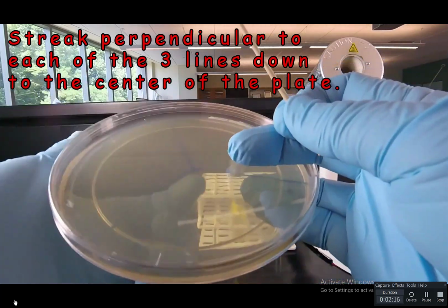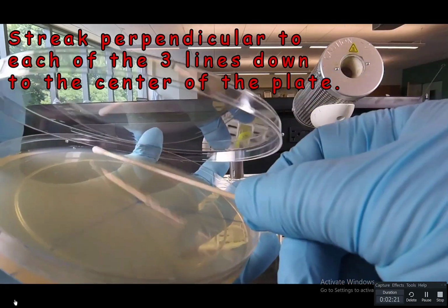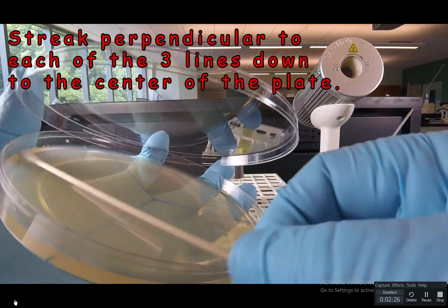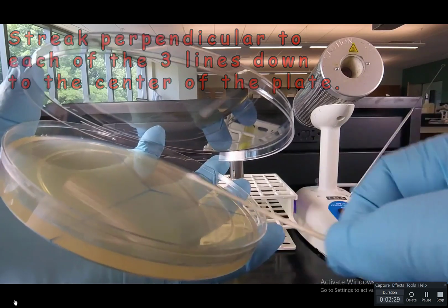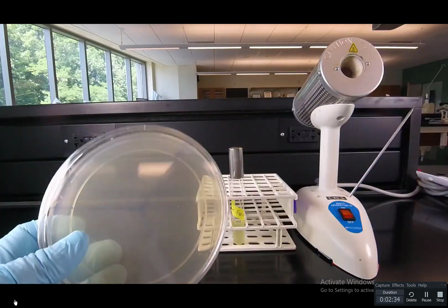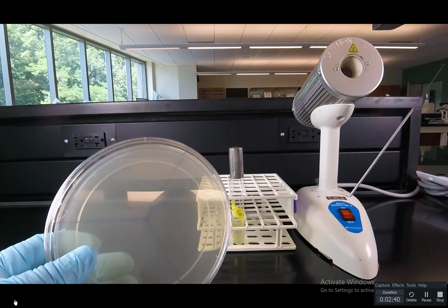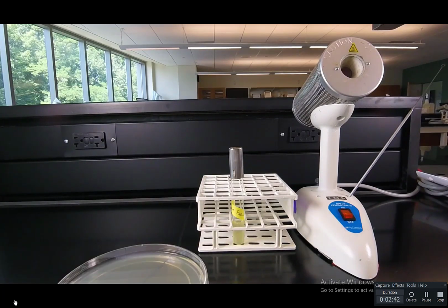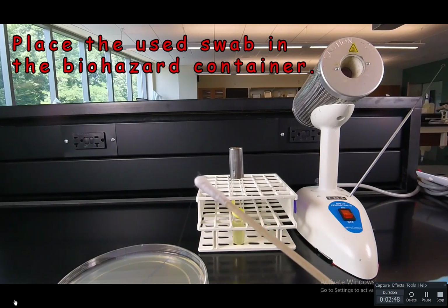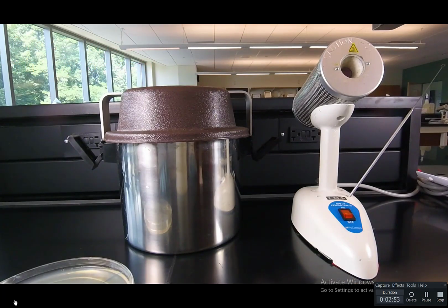And finally rotate it to the last line and streak perpendicular to that line, all the way to the edge of the plate and all the way down to the center. And now we've inoculated the plate so that the whole plate will show solid bacterial growth next time. Of course, when we're done with the swabs, they're going to go in the biohazard container. Now we're ready to put on the antibiotic discs.